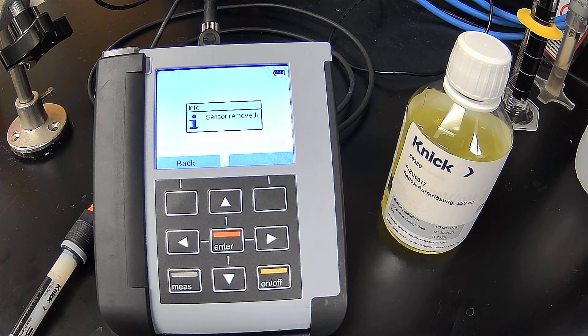Hello, this is a video on how to calibrate an ORP electrode, a Memosense ORP electrode, and we'll be using a 907 multi-portable analyzer for the calibration.